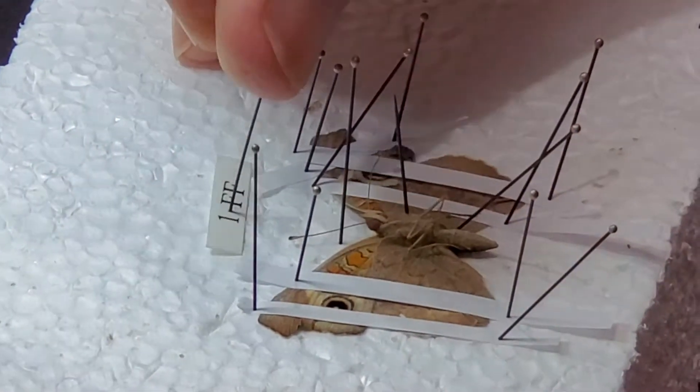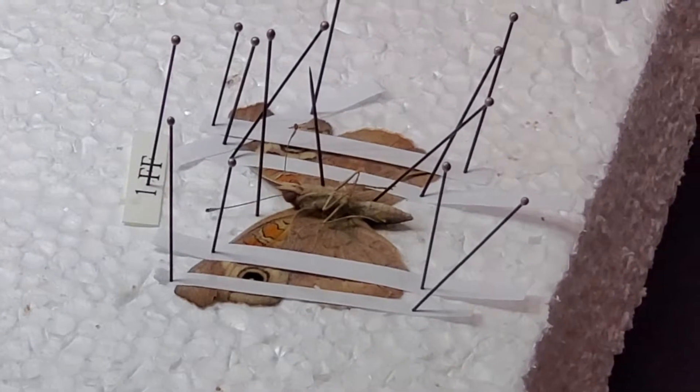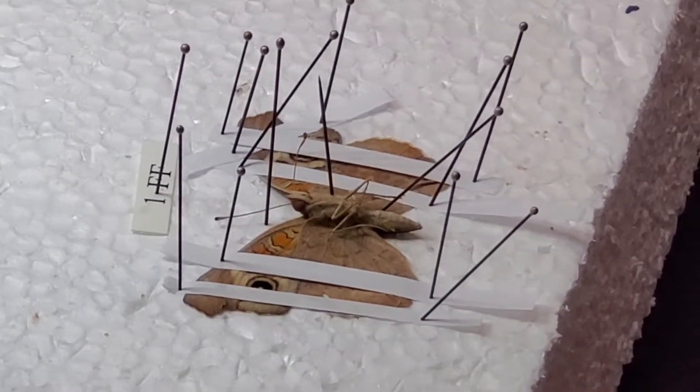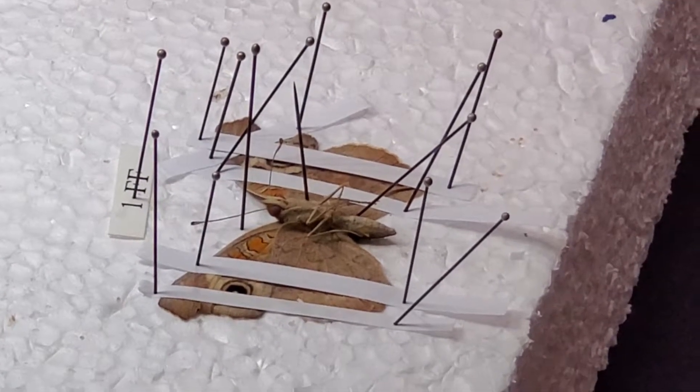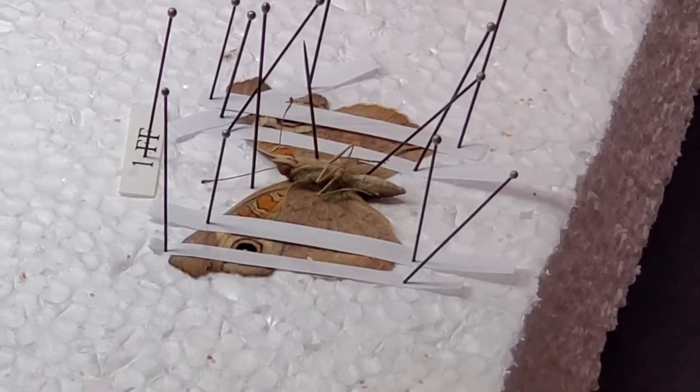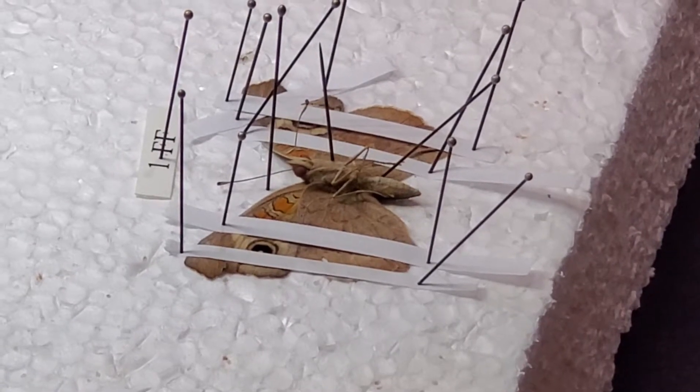The label. If you don't have the label, you haven't completed the job. You're going to make a lot of mistakes because you're kind of busy right now. I know tomorrow morning I'll have time to label it. And tomorrow morning, oh, I'm late.